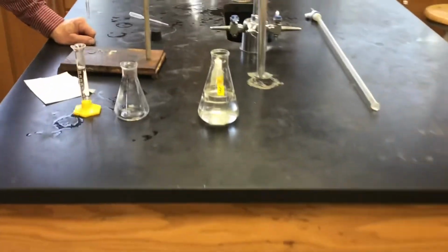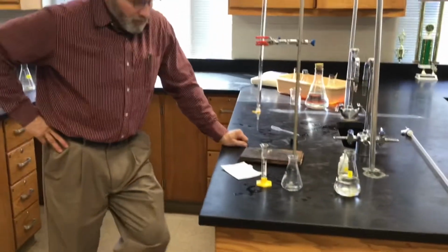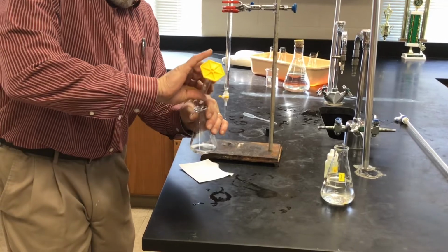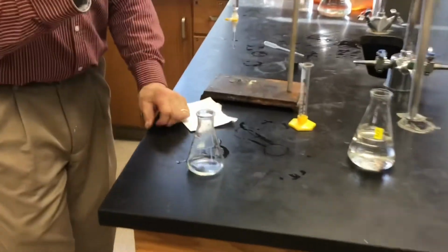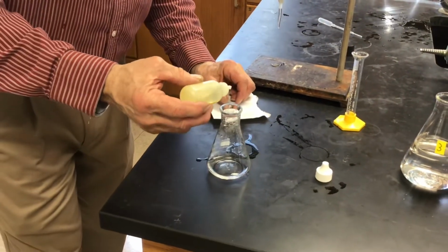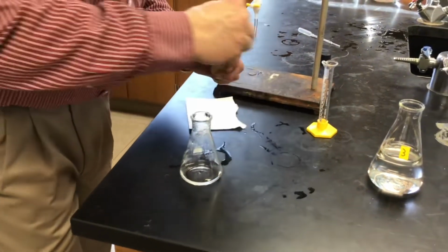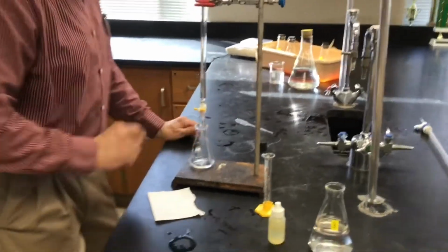Solution 3 of the Ag2X. And Mr. Hubble, looks like you've measured out 10 ml of that solution? Yep, we've got 10.0 ml of Ag2X. Remember, this is a saturated solution of Ag2X. Here's our indicator, iron +3. We've learned over the years that 6 drops is about the right amount. 1, 2, 3, 4, 5, 6 for the indicator. And we're ready to go.